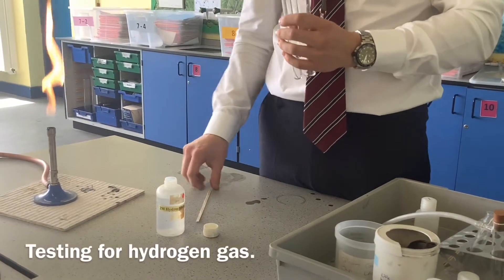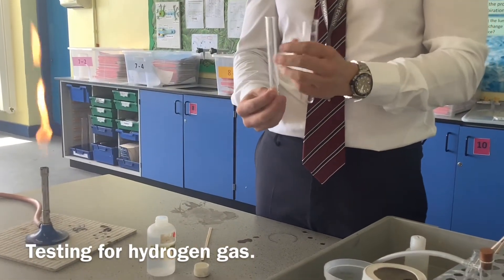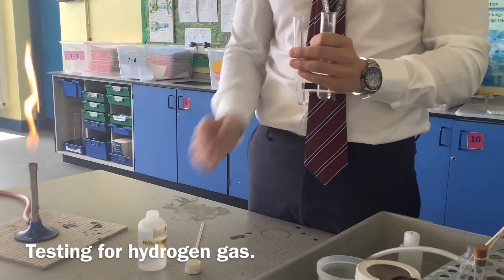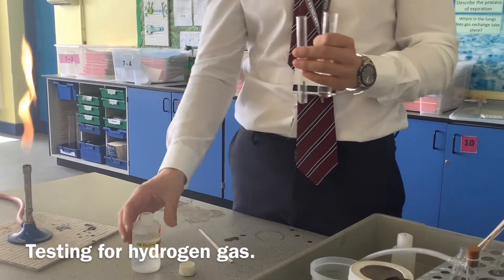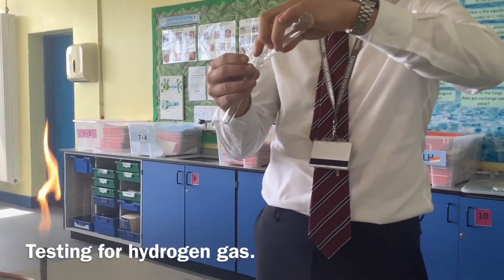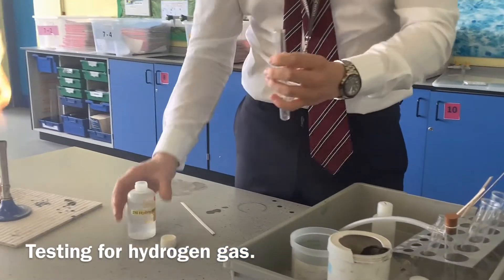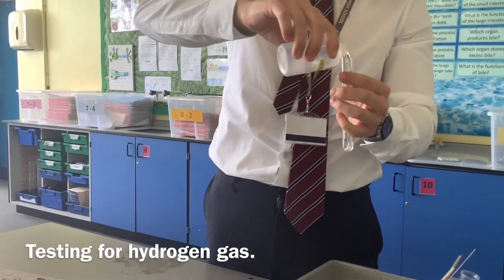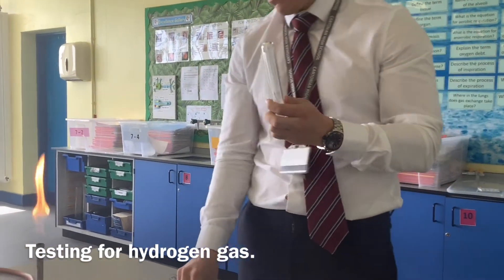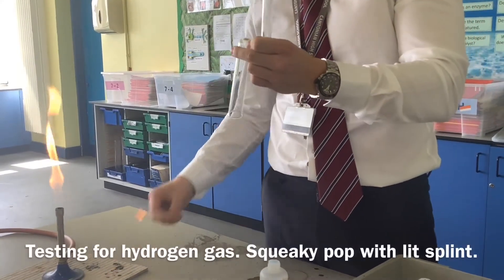We're going to do another specified practical — this is for the identification of gases. We're going to show you the squeaky pop test, which is for hydrogen gas. I've got some magnesium ribbon and some hydrochloric acid. When we have an acid and magnesium — a base metal — we'll produce a salt and hydrogen gas. I'm going to put some acid in here, quickly put the boiling tube on top to collect the gas, and put in a lit splint. Hopefully you'll hear the squeaky pop. There you go.